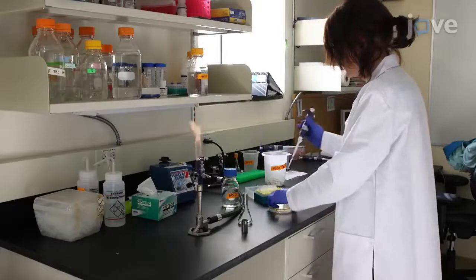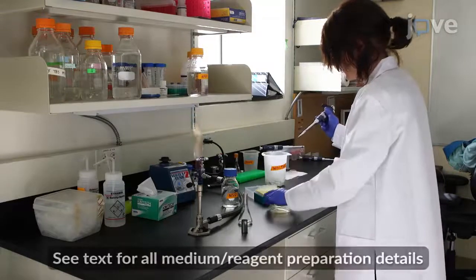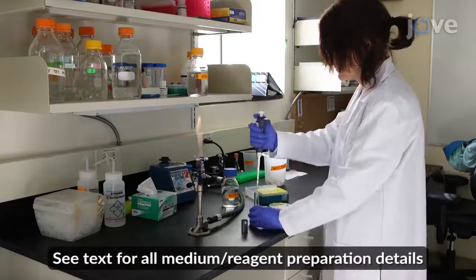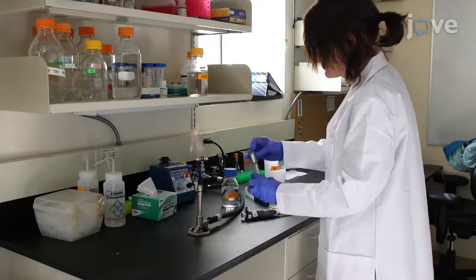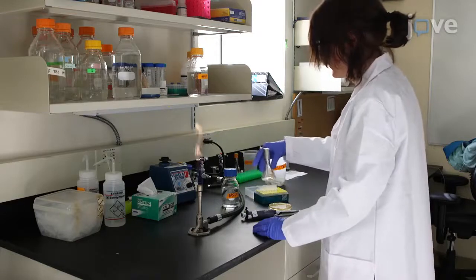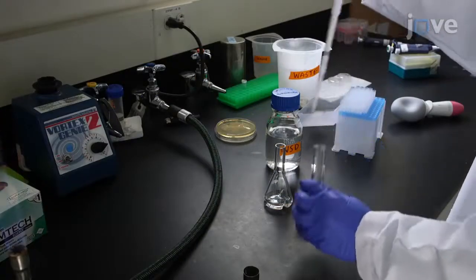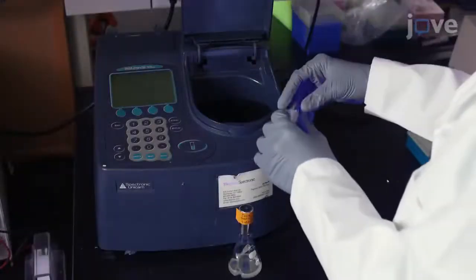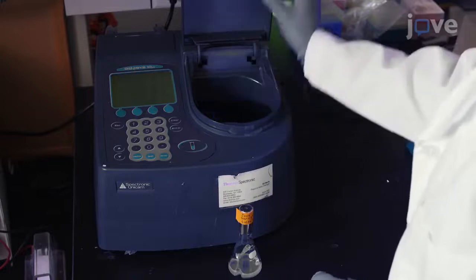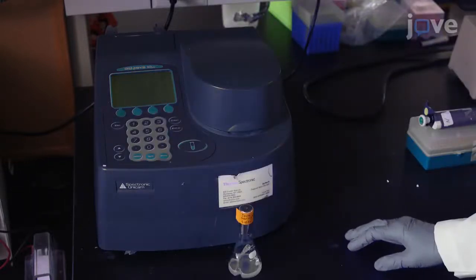Begin by growing an overnight culture of the yeast strain of interest in 5 milliliters of non-fluorescent synthetic defined, or NSD, medium in a 50 milliliter baffled flask with good aeration at 23 degrees Celsius. 3 to 4 hours before the analysis, dilute the logarithmic phase yeast culture in fresh NSD medium so that the final optical density at 600 nanometers, or OD600, will be 0.5 to 0.8 at the time of imaging.